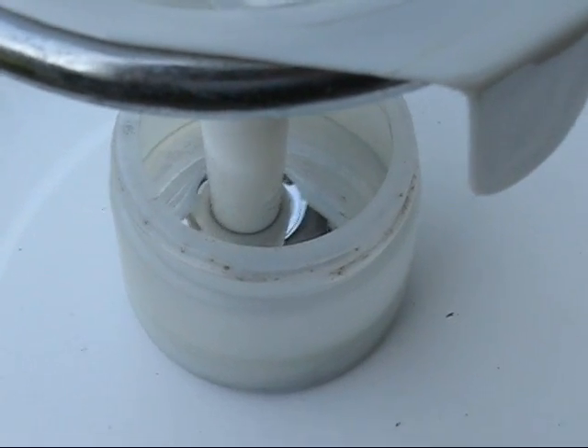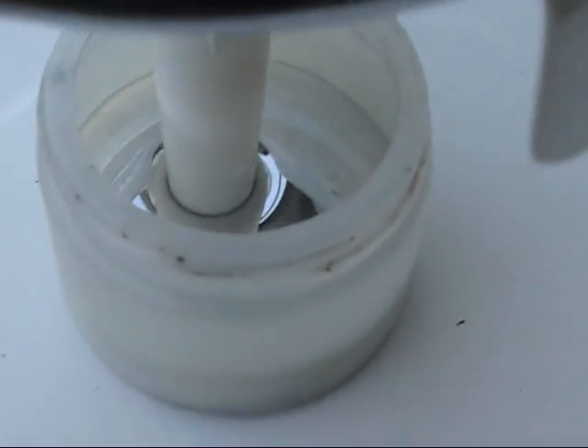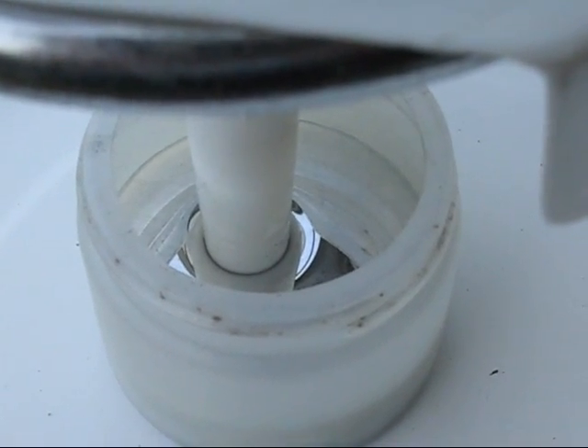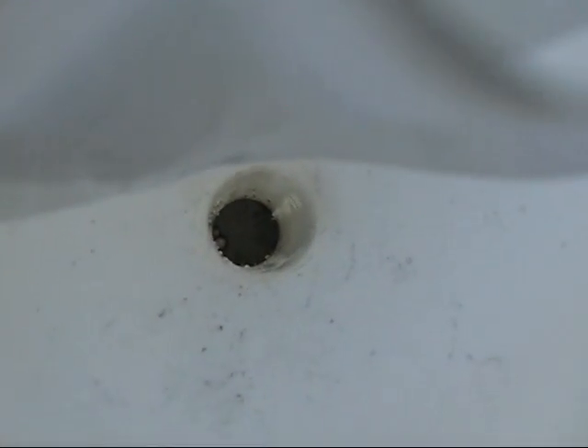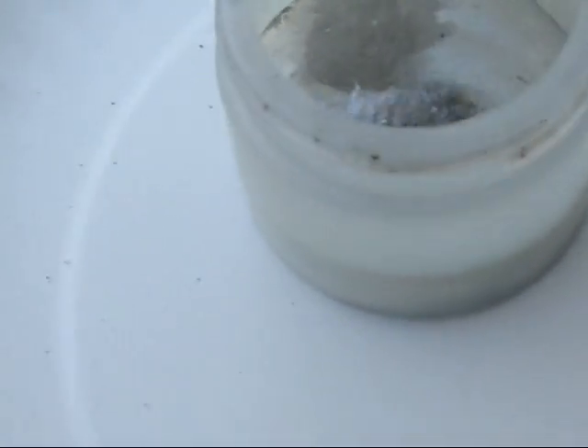And for a little comparison, that's in, and that is on top — yeah. Looks filthy. I want to try and squeeze the rest out, but I don't want to contaminate that, and also I don't know how dirty it is within the funnel stem. And that's what I got left, a few droplets. Unfortunately it's filthy down there, but it's clean from outside. Looks good. Put that in there, you'll probably see a very dirty middle. Yeah, it has vastly improved.